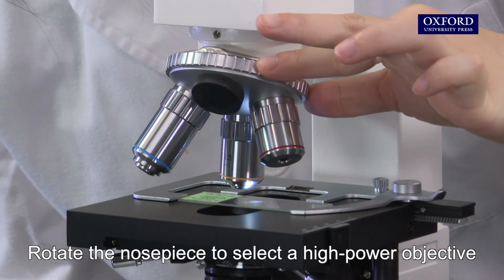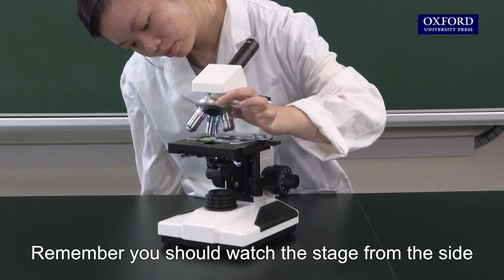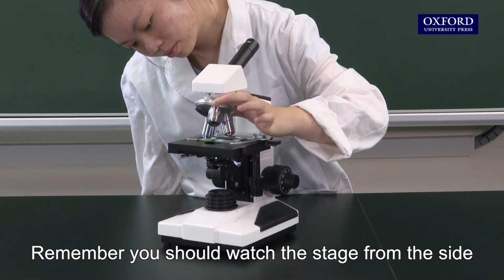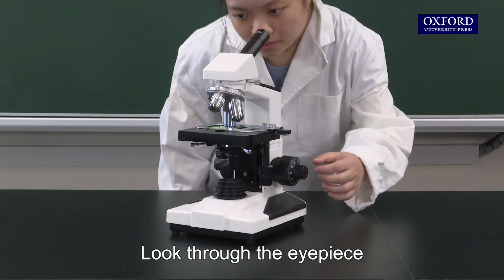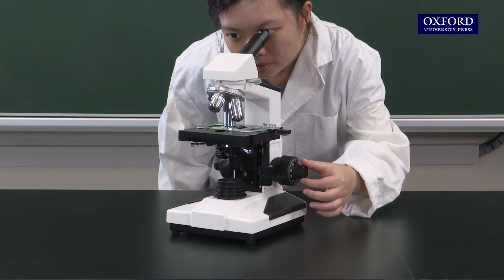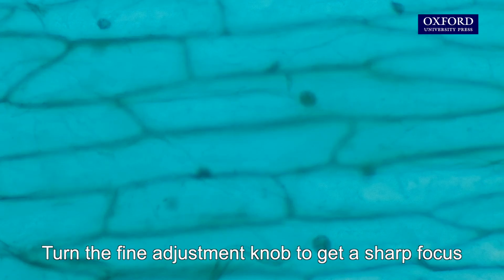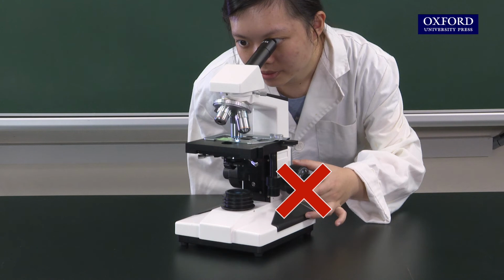Rotate the nosepiece to select a high-power objective. Remember, you should watch the stage from the side when rotating the nosepiece. Look through the eyepiece. The specimen should be in rough focus now. Turn the fine adjustment knob to get a sharp focus. Do not focus with the coarse adjustment knob.